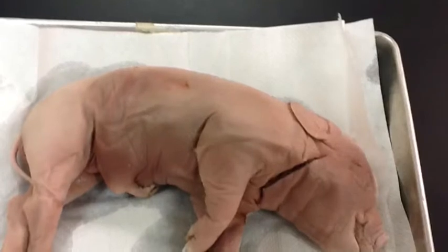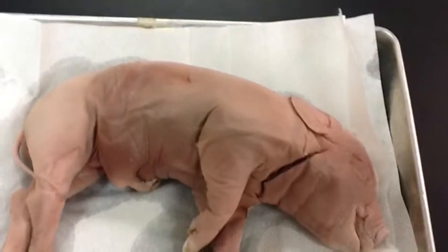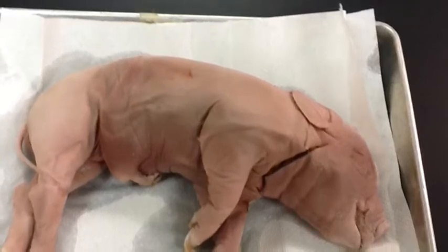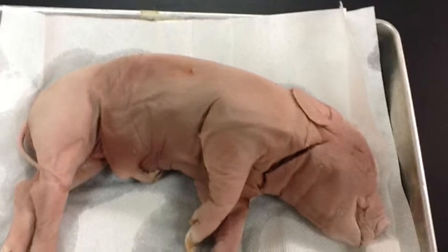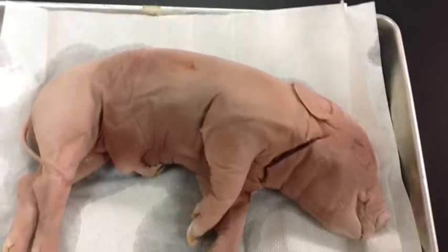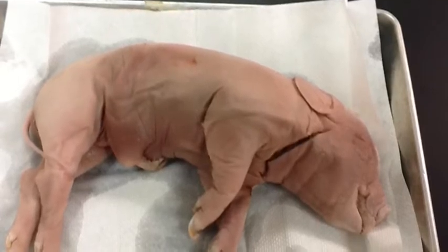Here you see our pig. The head is separated by a movable neck from the trunk, which is split into three parts: the anterior thorax, the posterior abdomen, and the pelvis. Here you can also see the limbs of the pig, which move differently from those of a human. The limb is not as flexible as a human's, and the pig walks on only 2 of its 4 toes. Upon examination, it was determined that our pig was male.